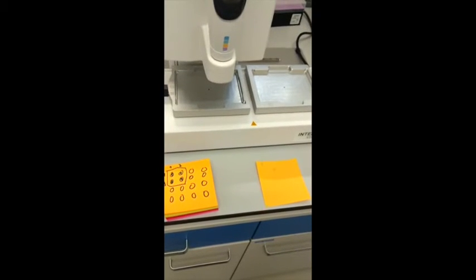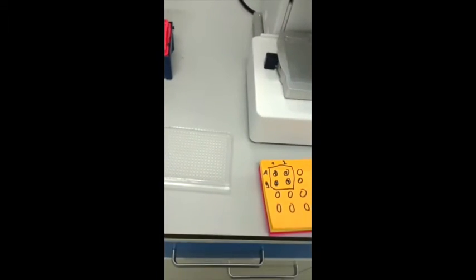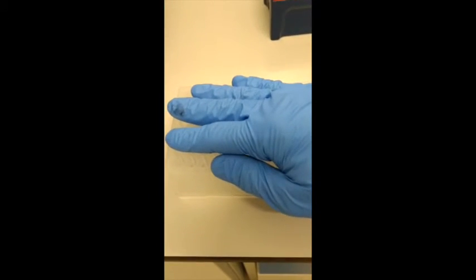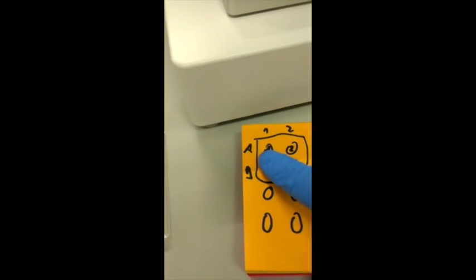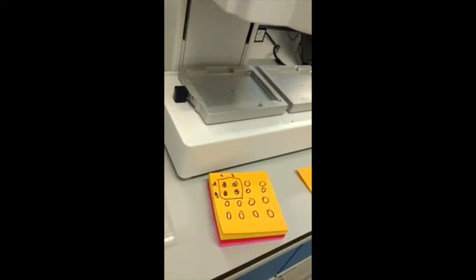Also with a pipette with 96, but then we also go all the way down here and have the 96, but do exactly the same, A1 here, the second plate A1 here, and so on. So either automatic or manually, but the procedure is always the same.